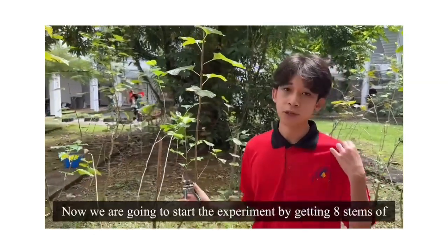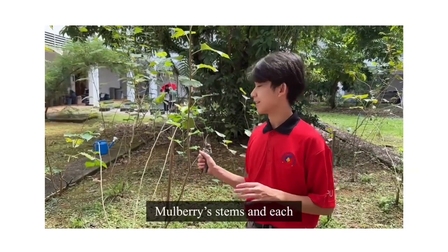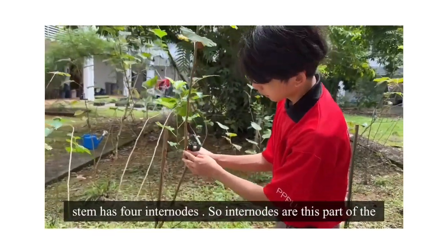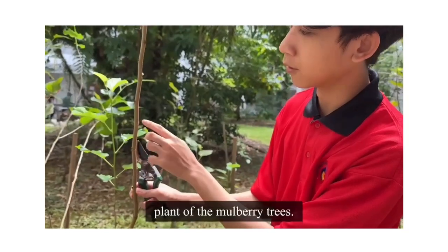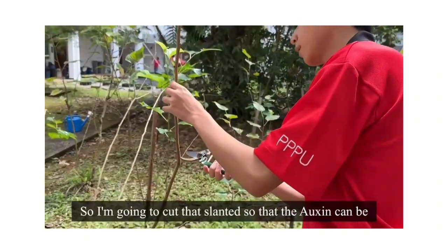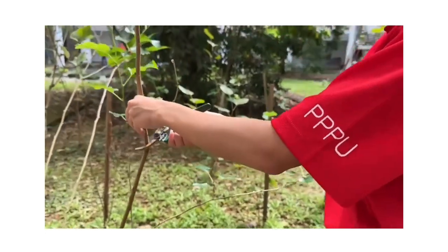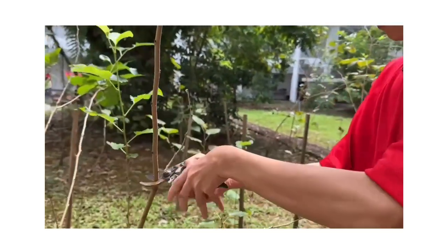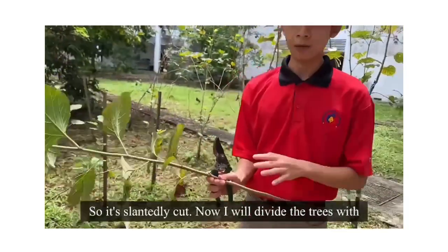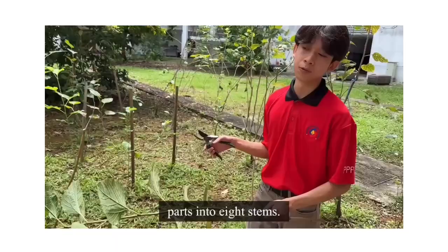Now we are going to start the experiment by getting 8 mulberry stems, and each stem has 4 internodes. So, internodes are this part of the mulberry plant. I'm going to cut slantedly so that the auxin can be absorbed more efficiently. So it's slantedly cut. Now I will divide the tree with 8 parts into 8 stems.